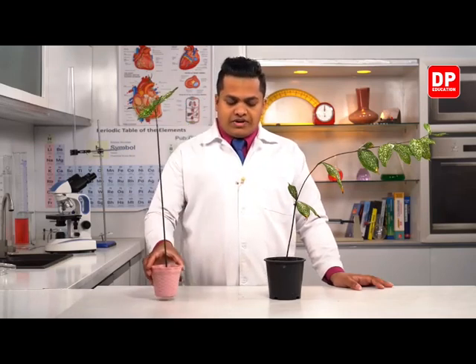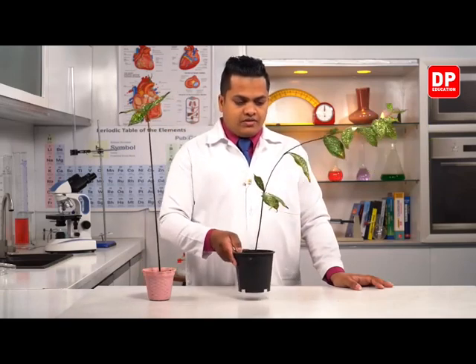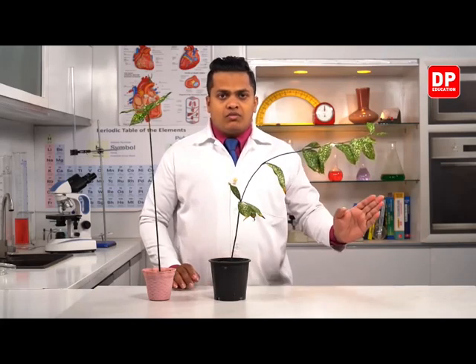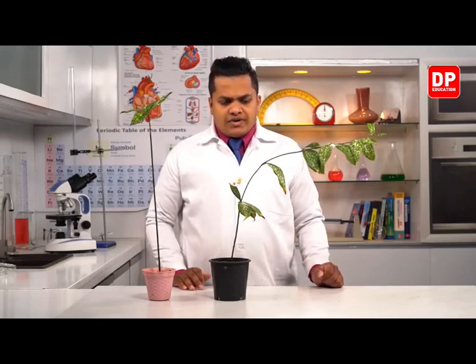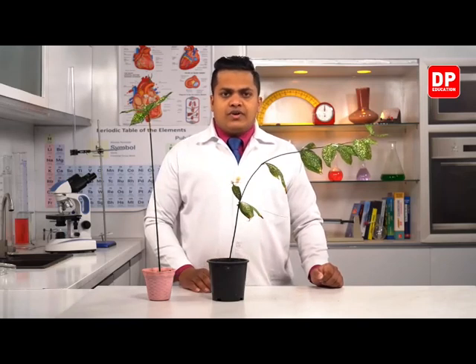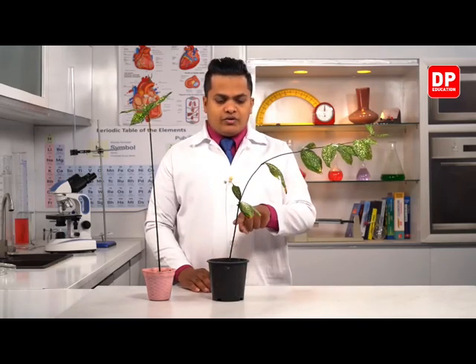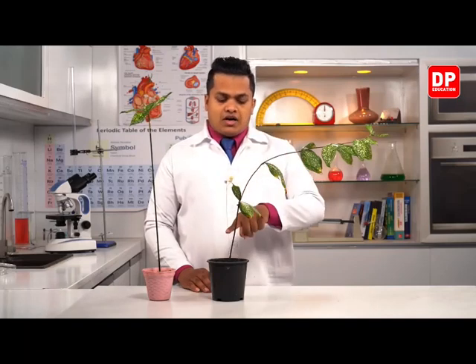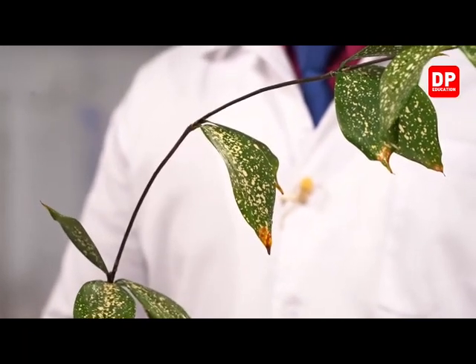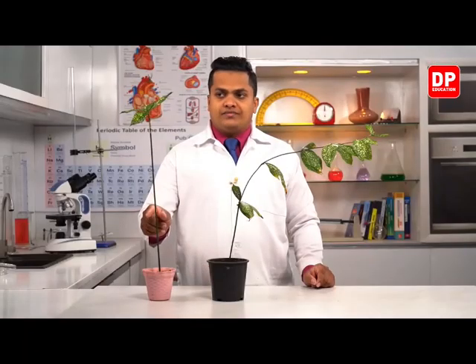But however, my dear children, I have kept this plant in a room-like place where the sunlight is going to fall from a side, not from directly upward. So in that case, my dear children, what has happened to the plant? As you can see here, it's very clear to us, the plant is not going to grow straight up. However, it's going to turn and grow, unlike the first instance, which is over here.